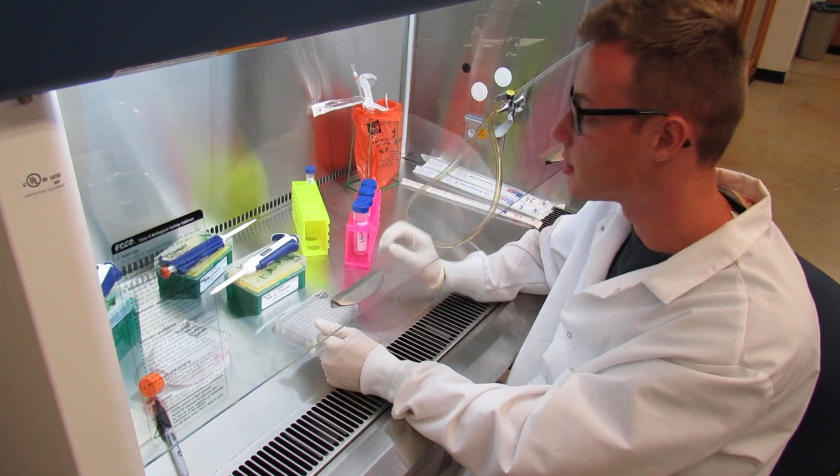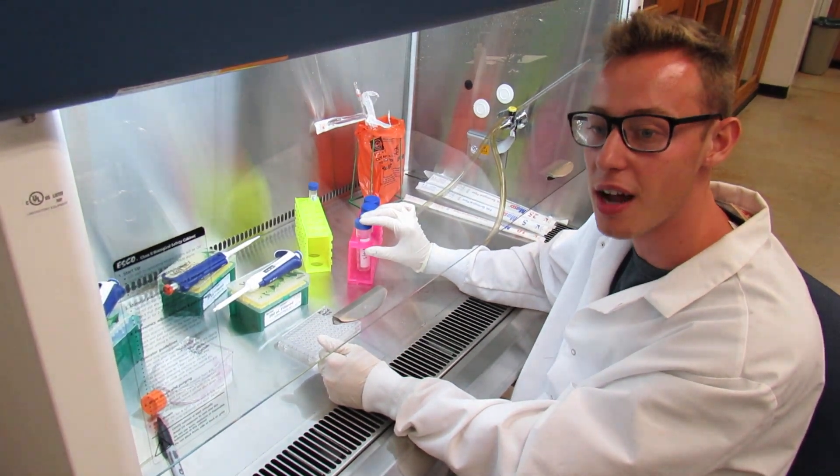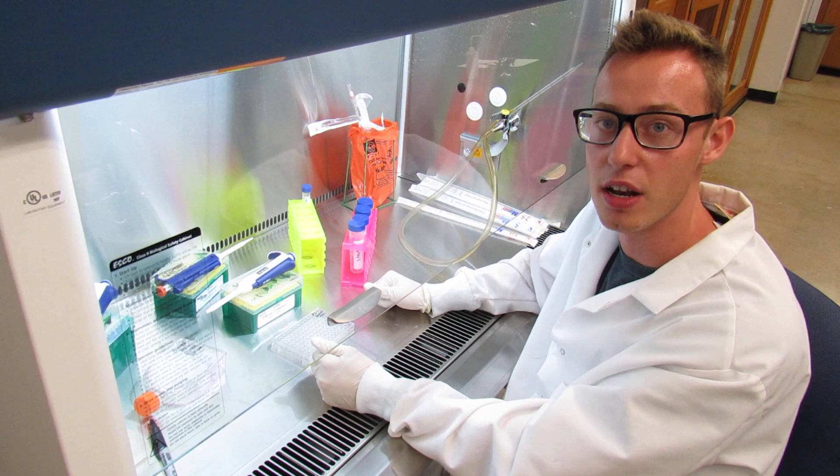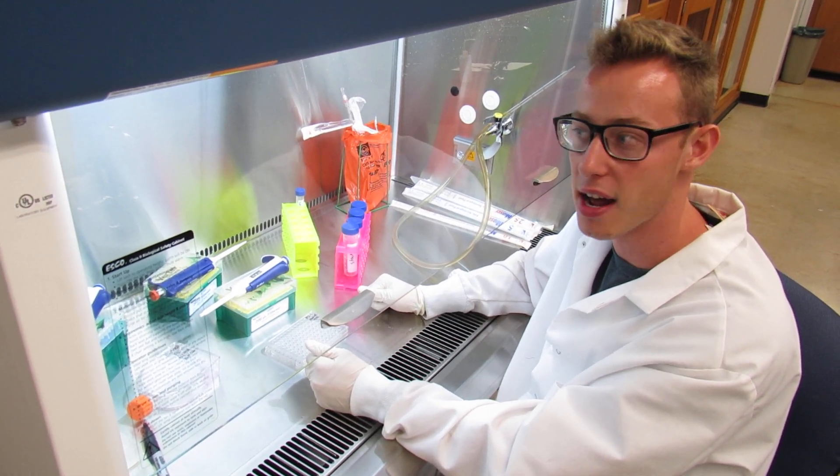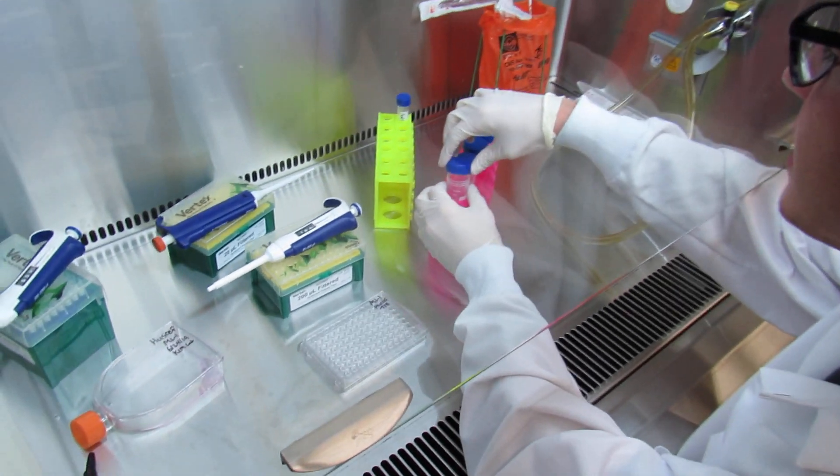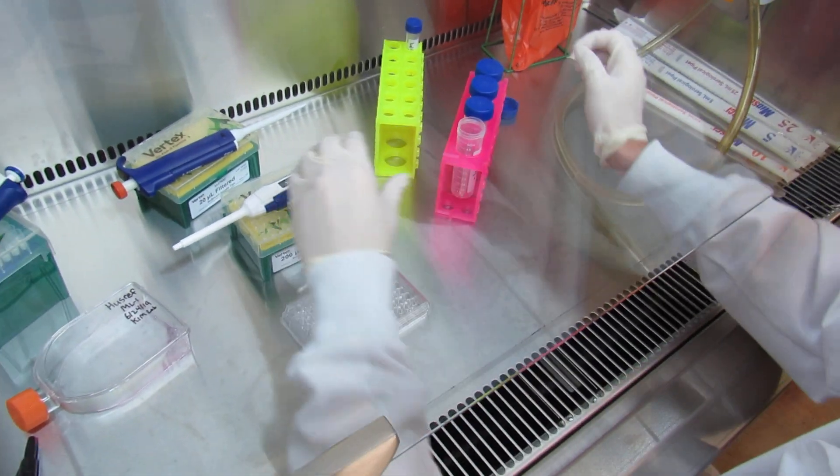you will pipette out 100 microliters of that cell DMEM stock into each of your designated wells as seen in the lab handout. So I will show you how to properly do that as follows.